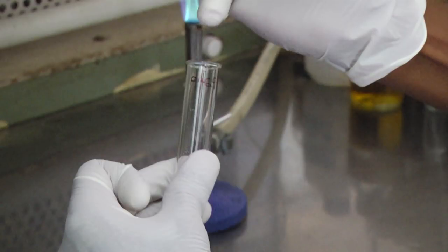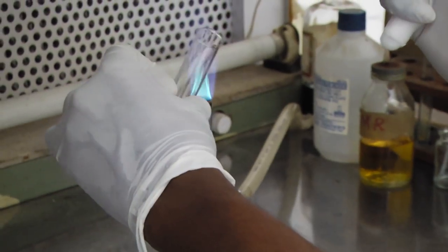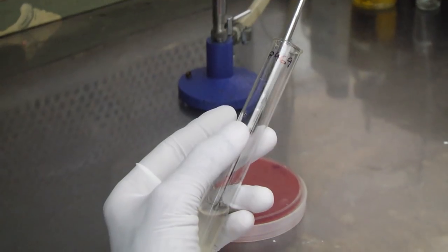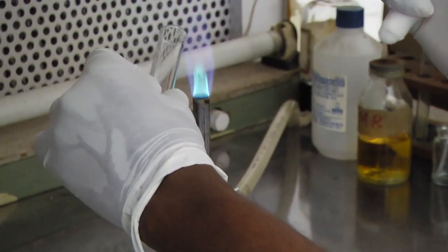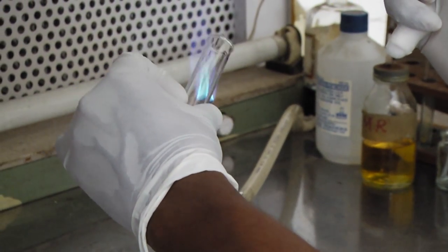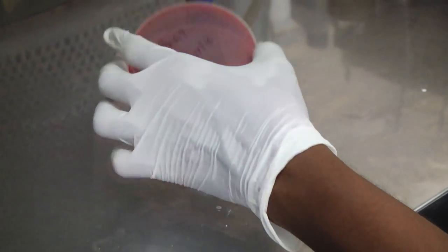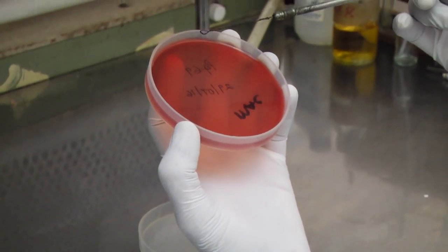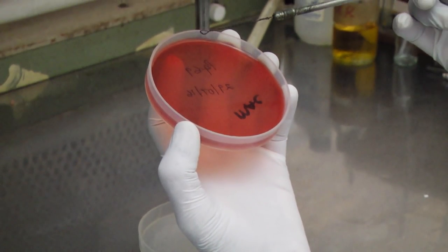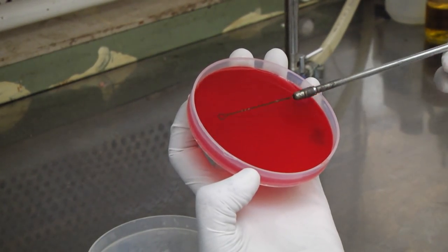Remove the cap or cotton wool plug of the bottle or test tube with the little finger of your right hand and flame the neck. Load the inoculum onto a sterilized wire loop. Flame the neck of the bottle or test tube and replace the cap or plug. Lift the base of the plate containing the medium in your left hand and hold it using your thumb and middle finger. Spread the inoculum thoroughly over area A — this is called the well inoculum.